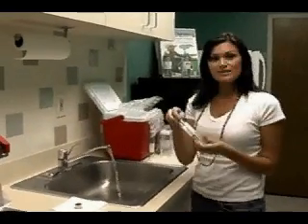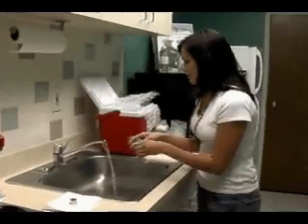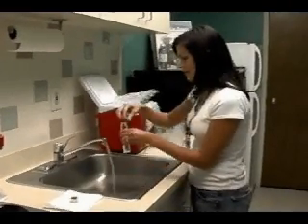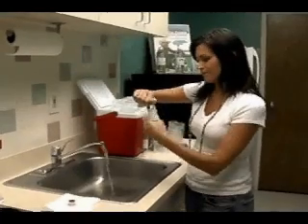This takes about three to five minutes. Once that is done, just fill the bottle up so it is slightly overflowing. Cap it tightly. Flip it upside down to check for an air bubble and to allow the preservative to mix with the sample.